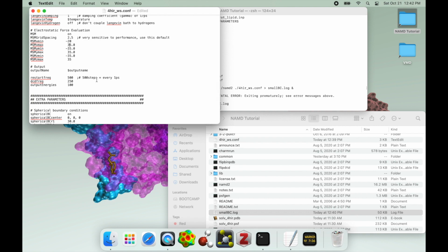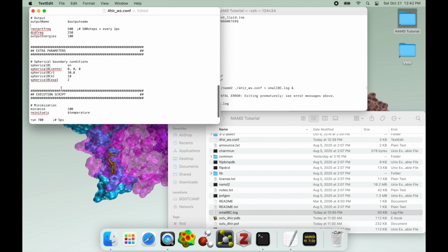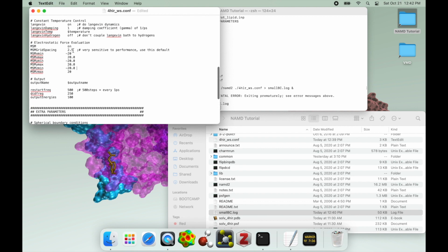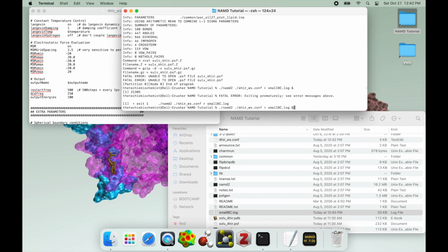the MSM grid. The MSM grid won't necessarily throw an immediate error as soon as you get to the end of the minimization steps. And in fact, the more minimization steps you use, the more you're able to potentially overpower an MSM grid that is too small. The turnaround, though, is that eventually one of those atoms, no matter how much you minimized it, is going to jump out of the spherical boundary. And if your MSM is even smaller than that, that means it's going to jump outside of the MSM grid, and that's going to throw an error too.